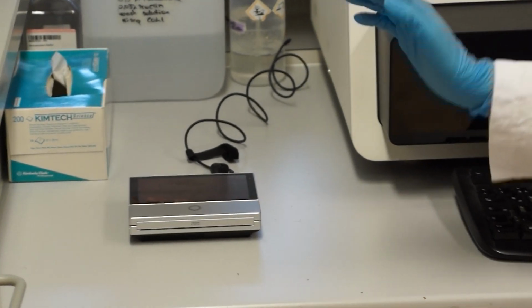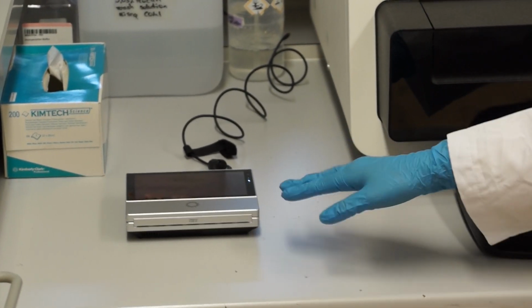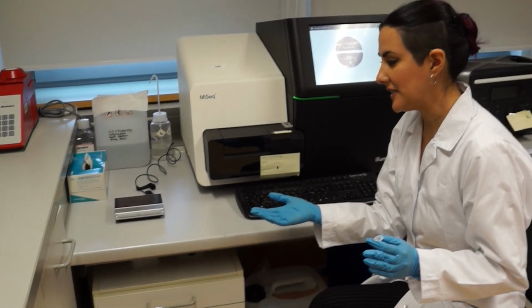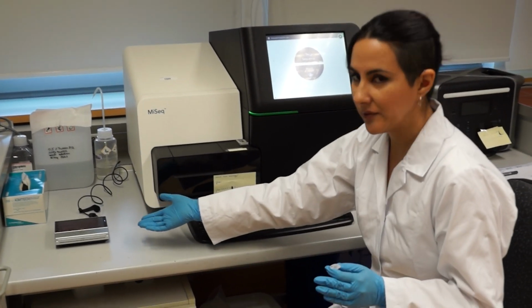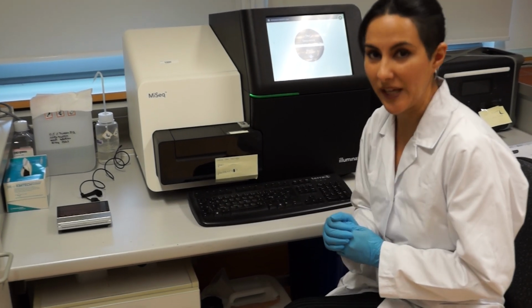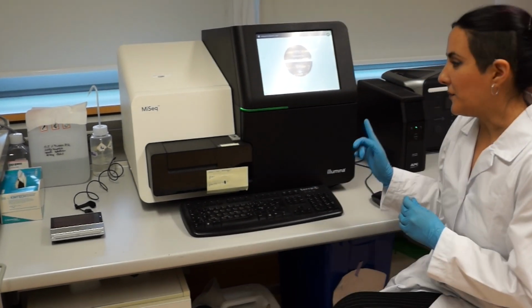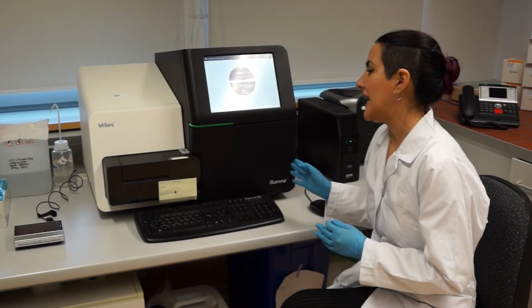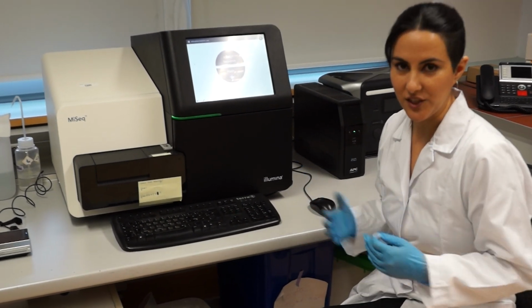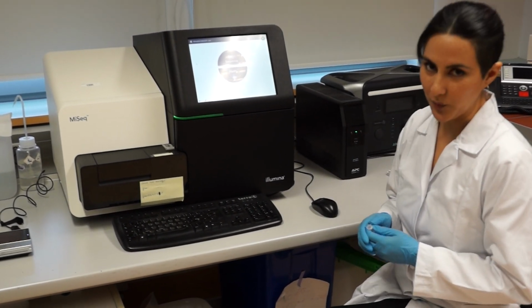So the big advantage of this one, beside the production of long read sequencing, is that you can carry it almost wherever you want and plug it in the computer directly. But from this one, we will have to connect to a specific software and machines to get our final output.